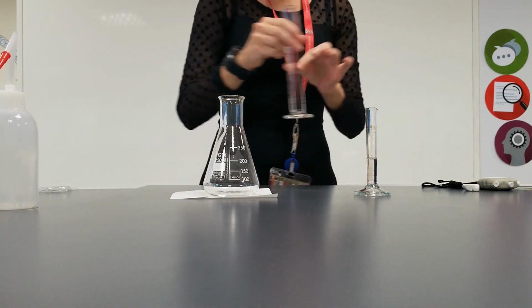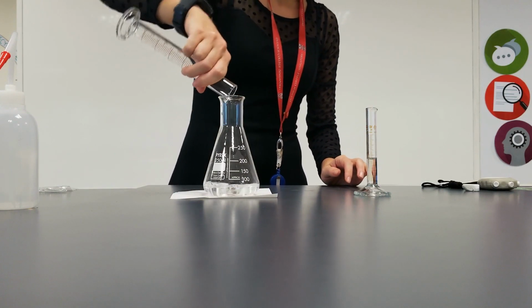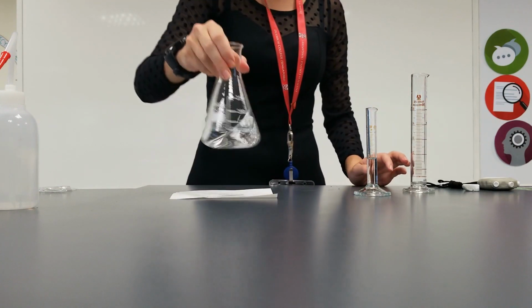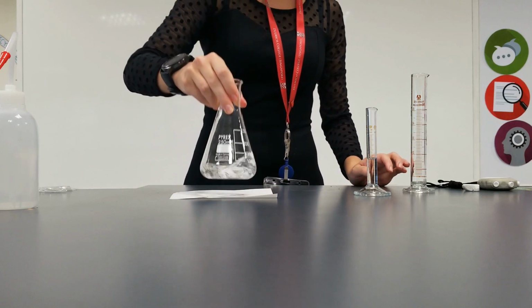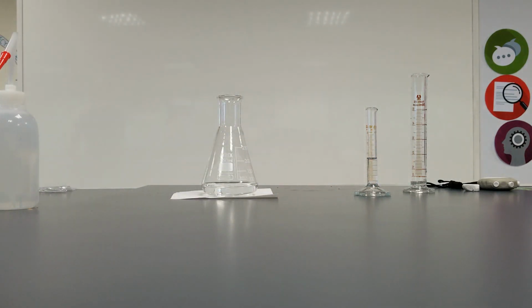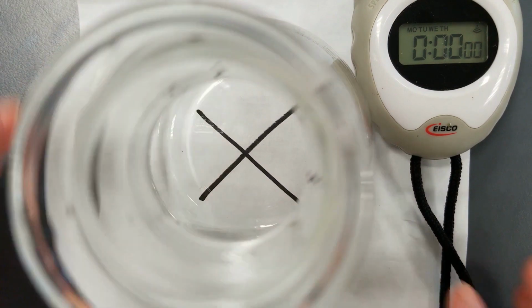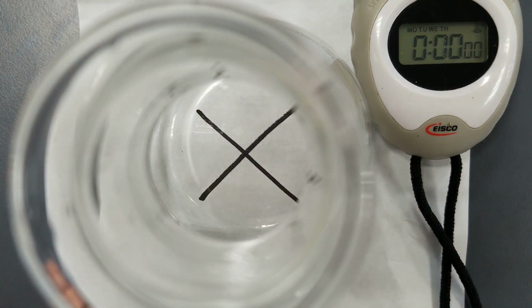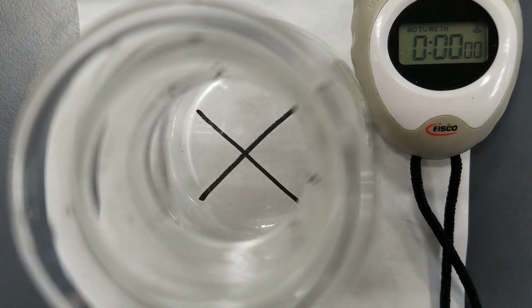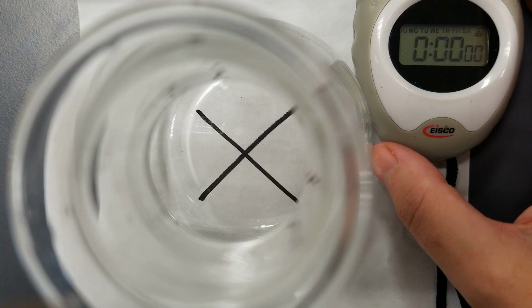Now it's important to give it a little bit of a swirl when you put it in your conical flask, because we don't want all the thiosulfate sitting at the top with the water and the thiosulfate nicely mixed together. Again, I'm going to push you over the top. Okay guys, so we have our 0.14. Hopefully you can see the cross through the camera, okay, and you should be able to see the timer. So I'm going to add my hydrochloric acid and start the timer at the same moment.